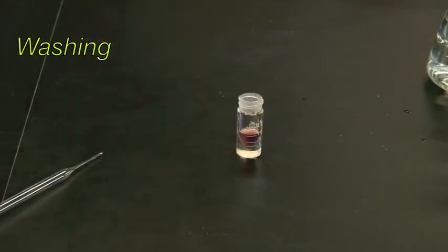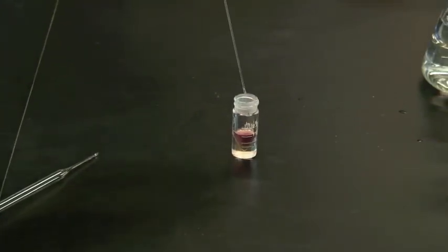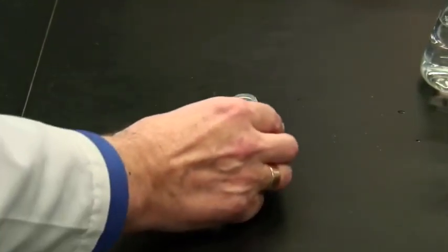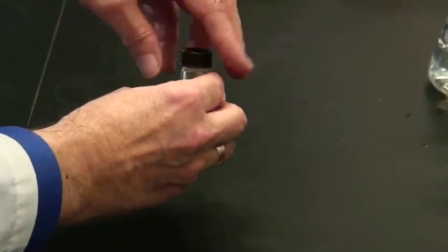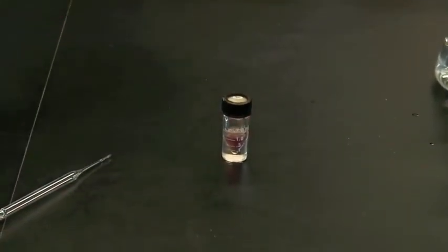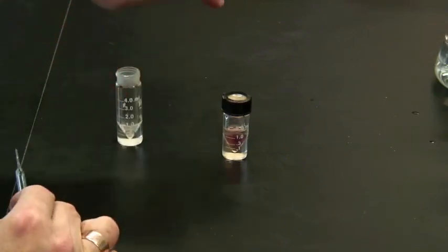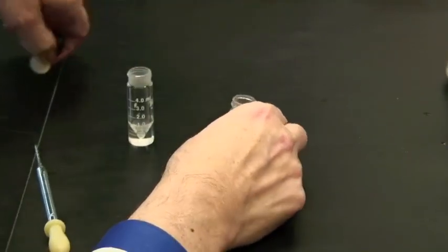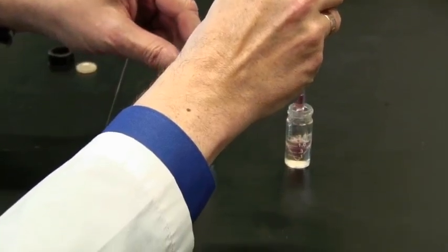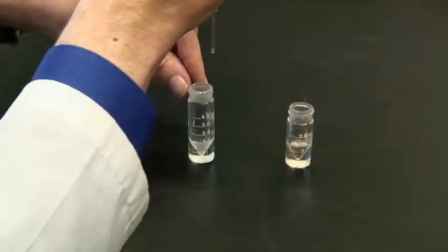This is the extra water wash which you discard and bring in some more fresh water or it may be a solution of some kind, aqueous material anyway. Add that. And we'll need to cap this second vial. Shake it up and wait till it separates. And again, this will now be placed into a third vial. You could use the original one if you've washed it out while waiting for this to separate. And that actually separated quite quickly. And again, flatten the Pasteur pipette. Remove the organic phase. Leaving as much water behind as possible.